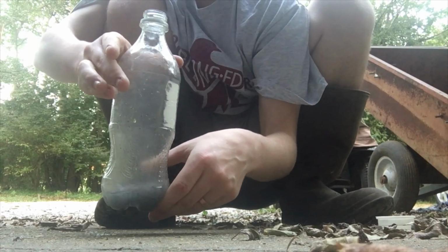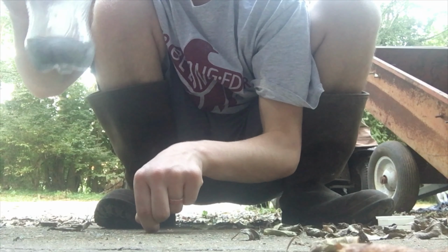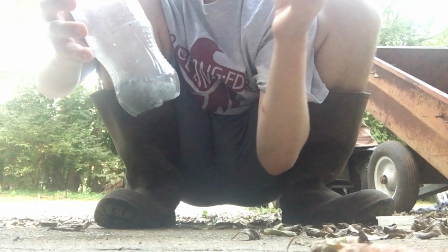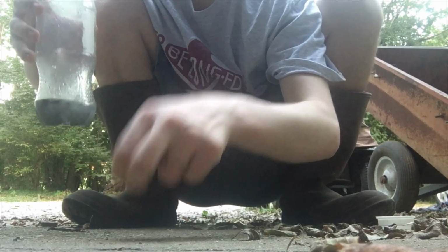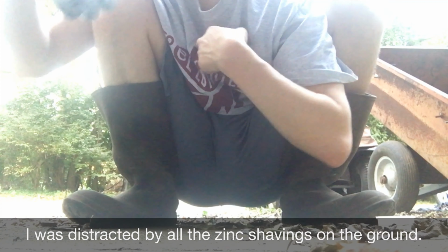I might do this in another video where we take this and boil off the liquid and leave only the salt. Like, if you take salt water and boil all the water away, you only have the salt left. So that's kind of the same thing we're going to do here.